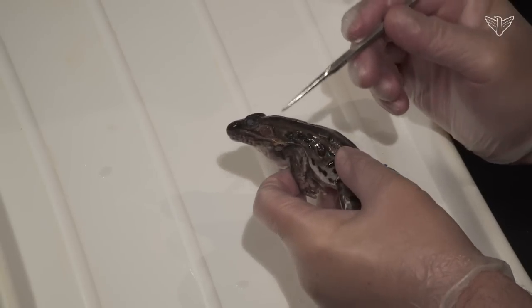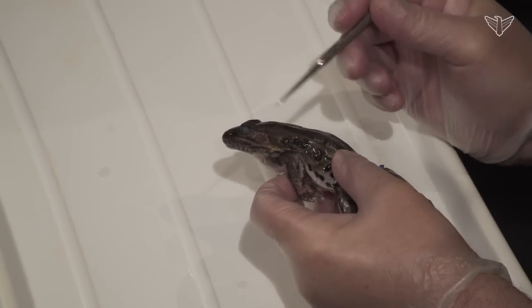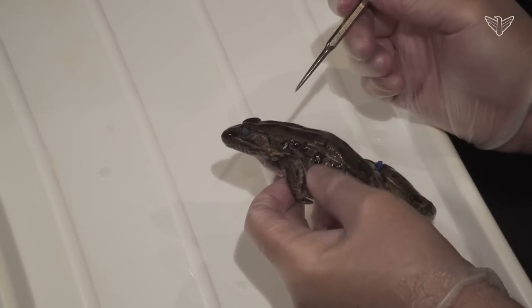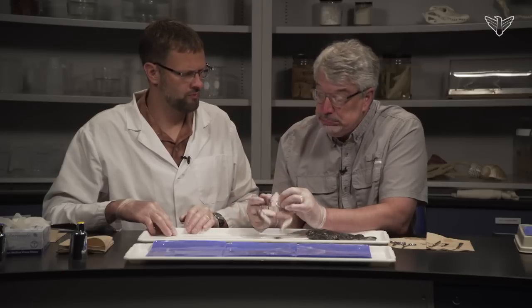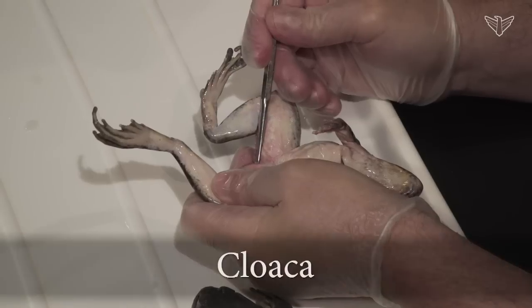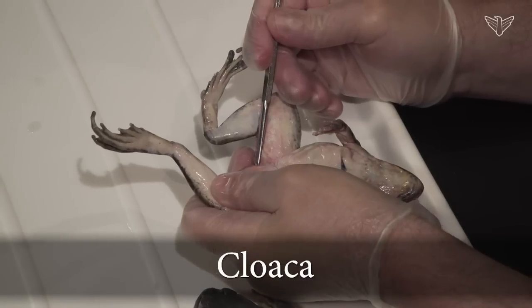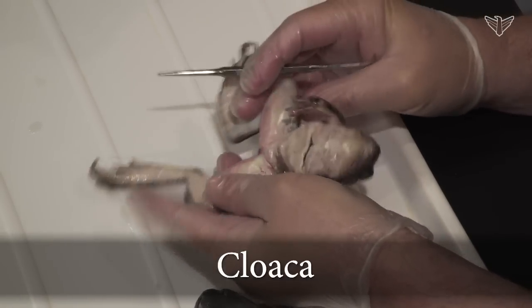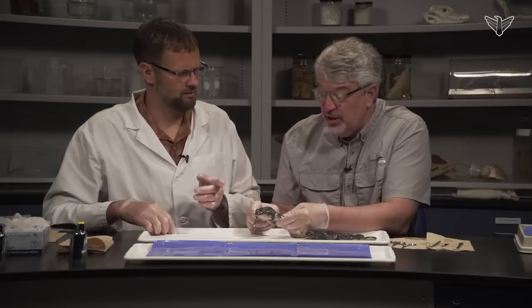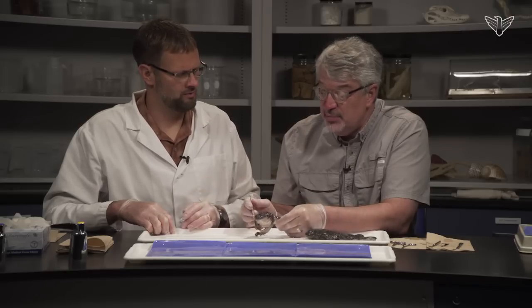Oftentimes the tympanic membrane of the male is often larger than the female's, when you see that. Externally, there's the opening to the genital and digestive system — the cloaca — a common opening. Other than that, externally, they're pretty simple animals.